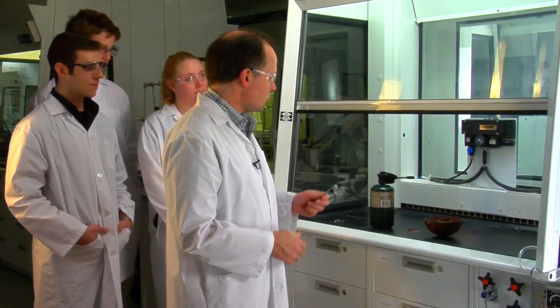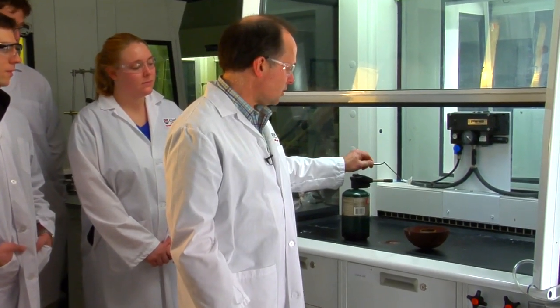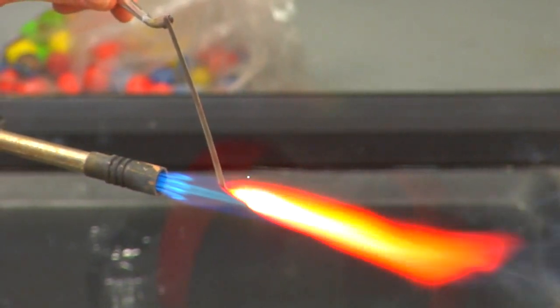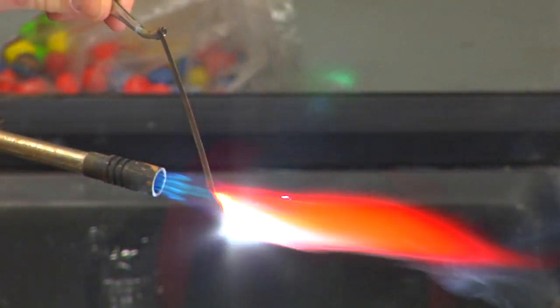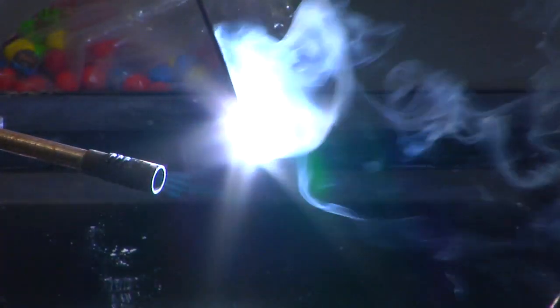So I'll show you one example of that. This is a piece of magnesium metal. If I put that in the flame, it will actually burn in air. So that's metal burning in air, becoming magnesium oxide.